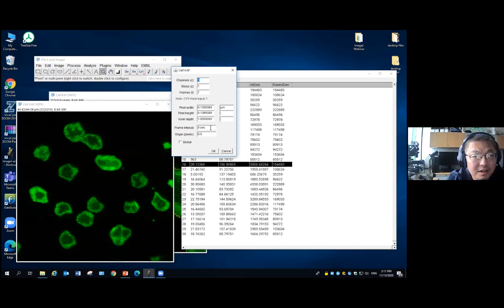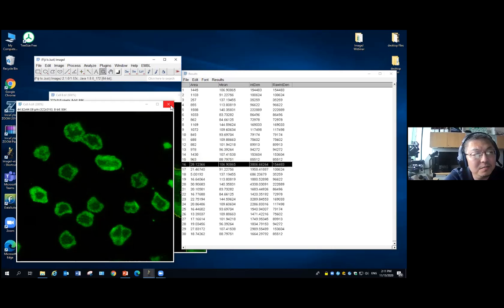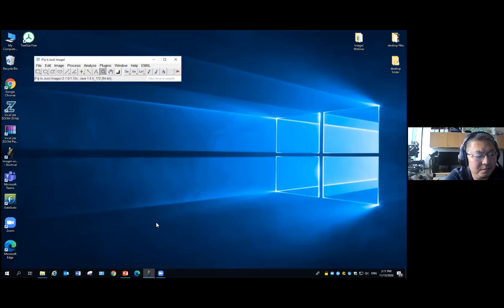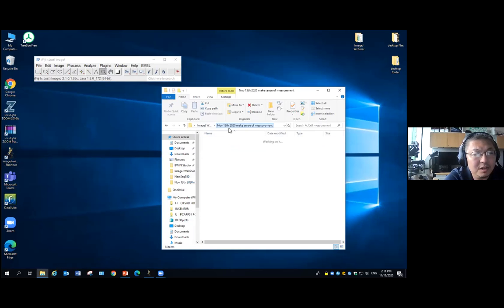Okay? And then the next question will be like, how do I know if it is always in micron units or nanometer units, or if somehow I lost the information or my raw data didn't give me the information, what can I do? Okay. So now we'll go to part B. I will close this. Go to B, the pixel scale.